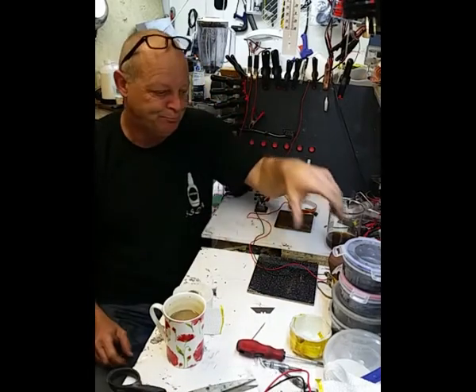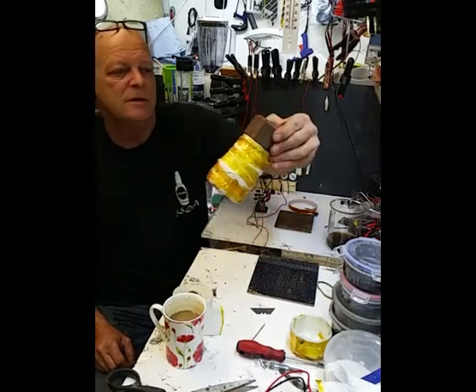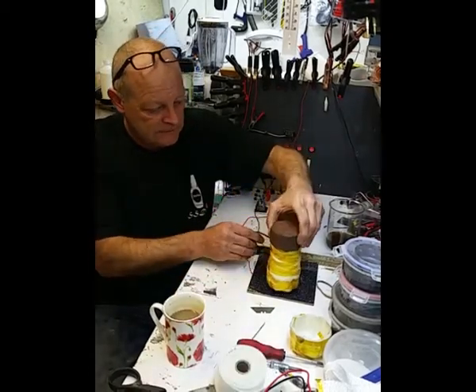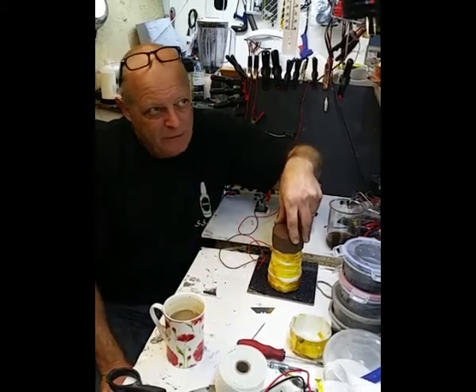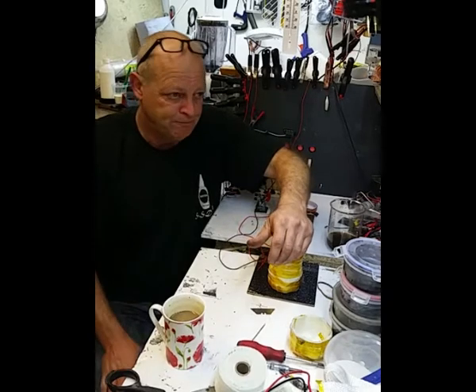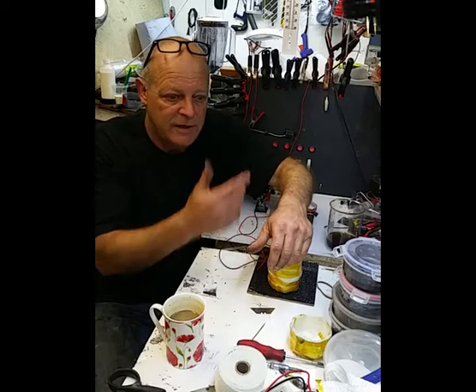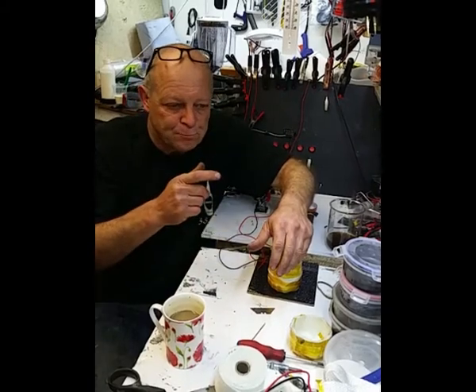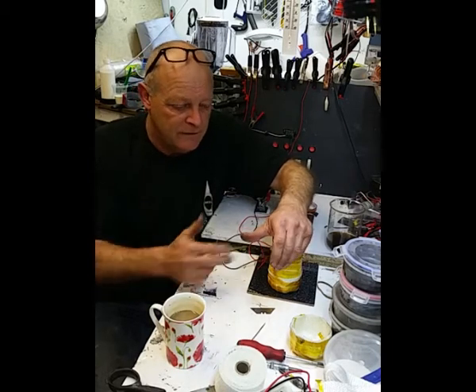So yeah, I thought, let's make a little blanket for it. So there it is. It's this stuff, obviously, and Kapton tape. And that's it. I'm going to try it like that. Now, in typical fashion with me, I don't think things through properly all the time. I was thinking this morning about the power supply and the amount of current that you're going to need for this. And I thought, you're going to need a big power supply. Or do you? I don't know yet, until I try this.